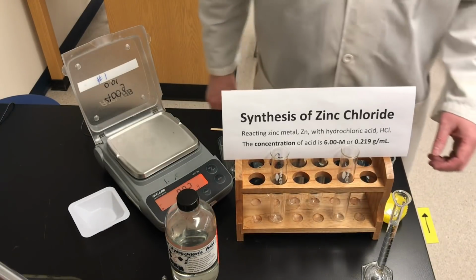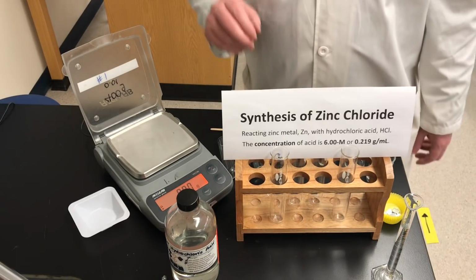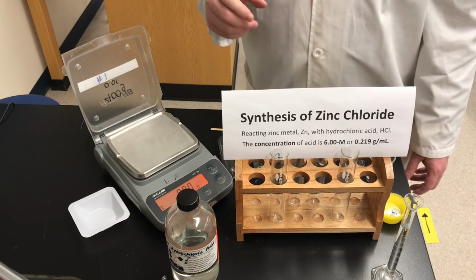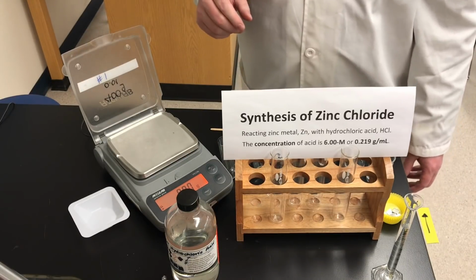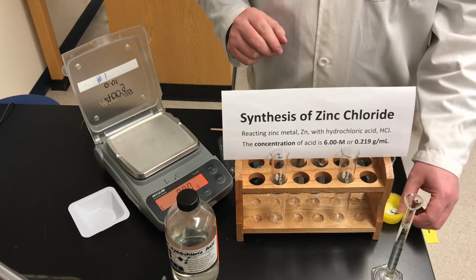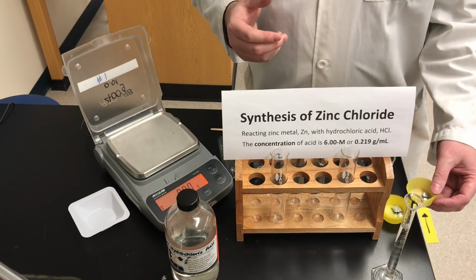Alright, in today's video we're looking at an experiment that we use in grade 9 advanced science, as well as you could use this in a grade 11 chemistry course where you're studying stoichiometry. It's called the synthesis of zinc chloride. In grade 9 science, in the advanced program, we do a unit on elements and compounds.